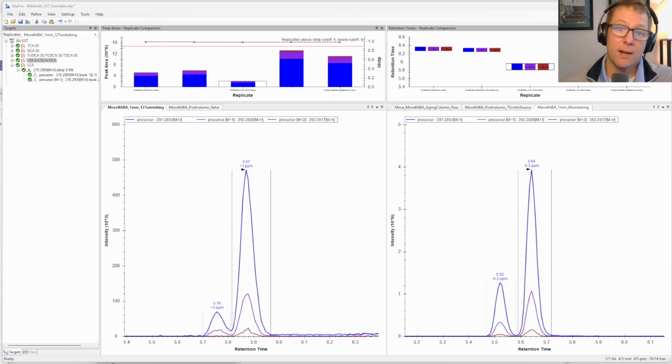So a little way to differentiate post-column broadening from maybe something else. So this is the first example, and the details of this are a 1 millimeter separation at 100 microliters a minute. And this is just showing the difference of using a 5 thousandths ID post-column connection.